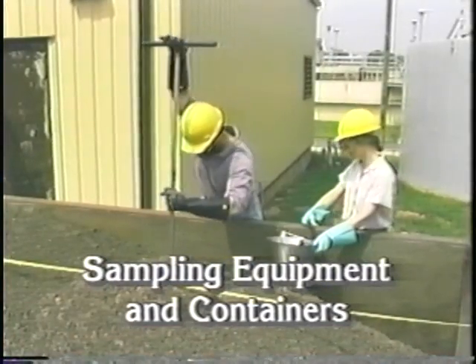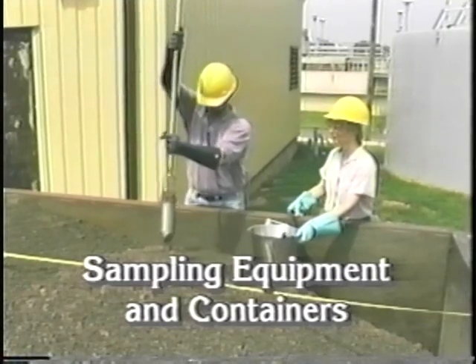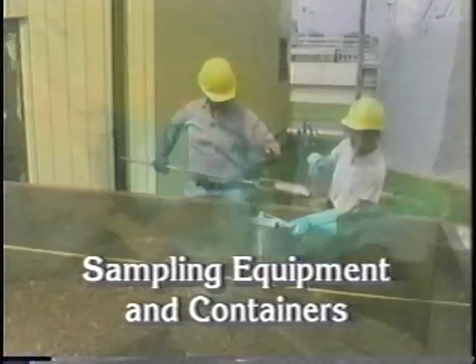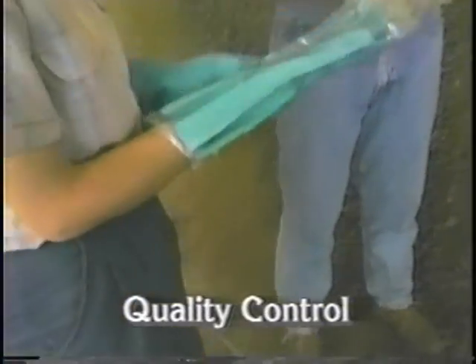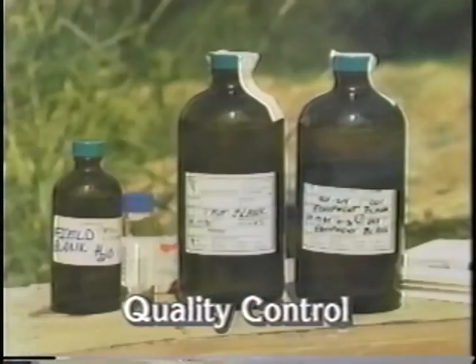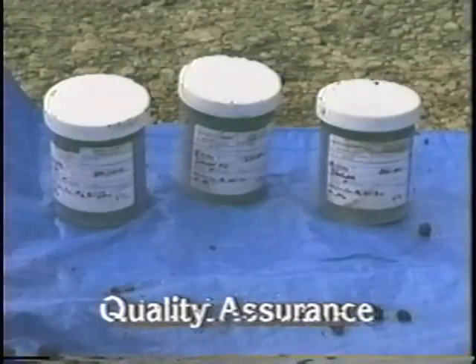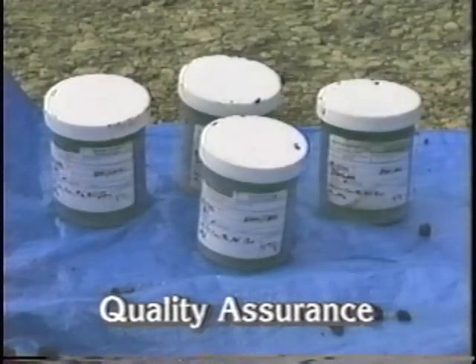The appropriate sampling equipment depends on the type of sludge being sampled and which pollutants will be analyzed. Think about possible sampling errors and how you will avoid them through quality control procedures such as equipment rinsate blanks and trip blanks. Proper quality assurance usually requires collection of extra samples.